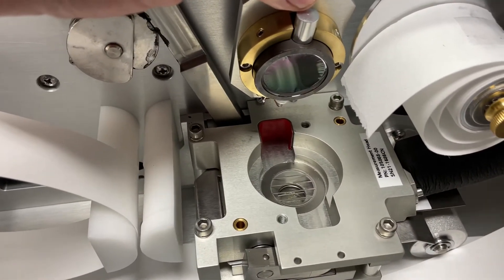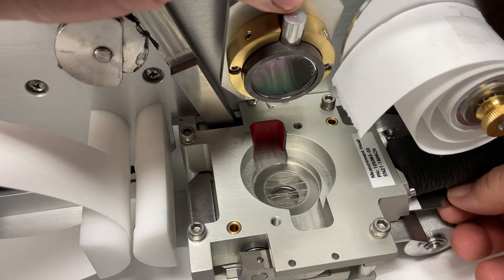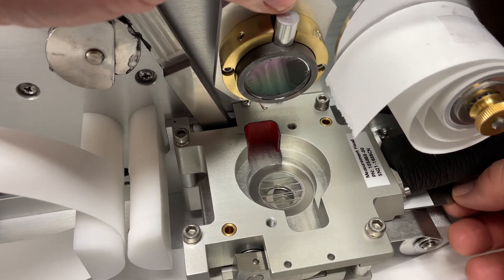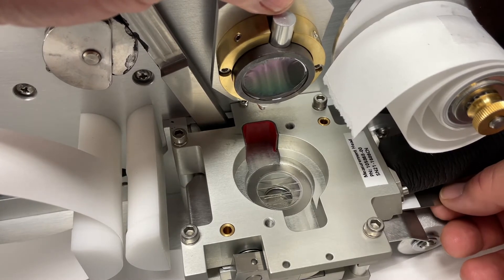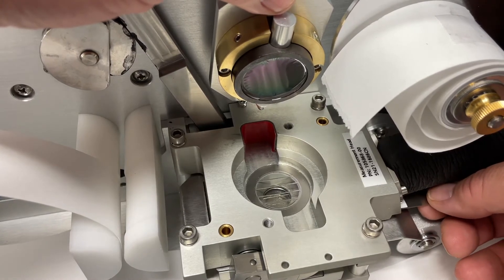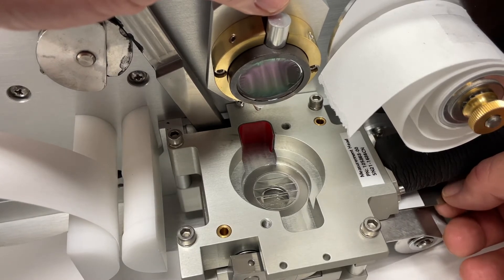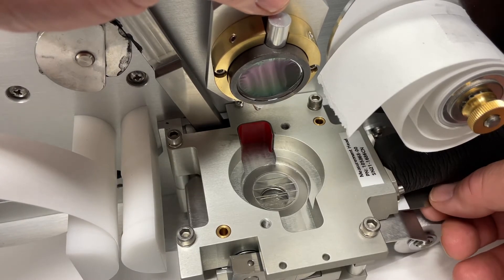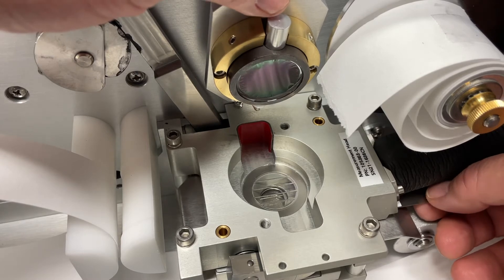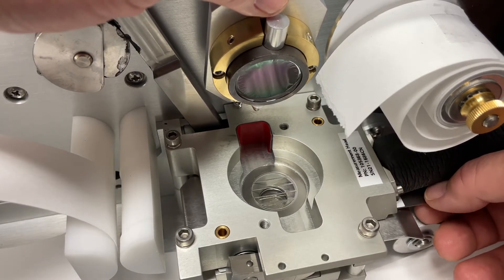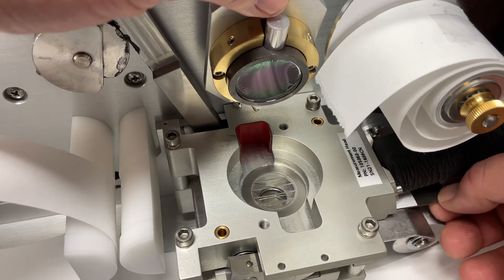You can see down in—I'll just focus down a little bit more—and what you'll see is when I slide this detector calibration foil back and forth, you can see it right there. There's that little circle I was talking about; you see the beginning of it.